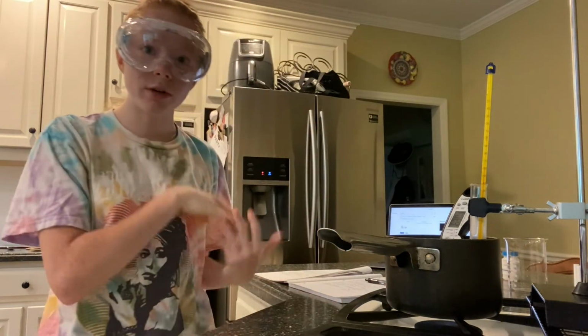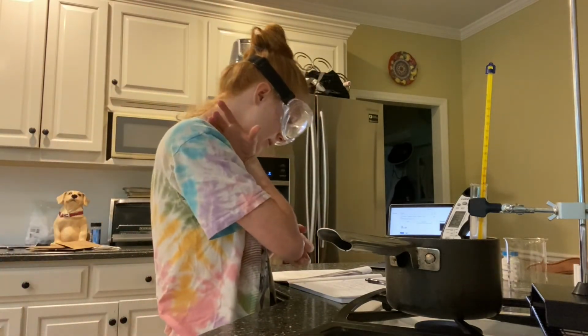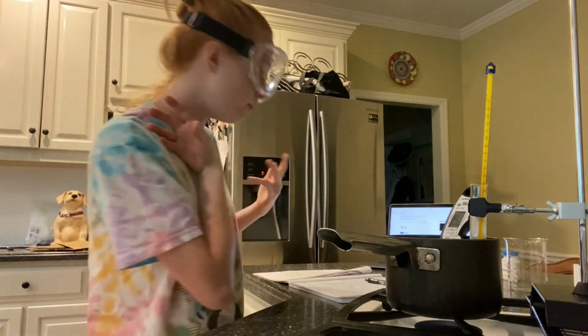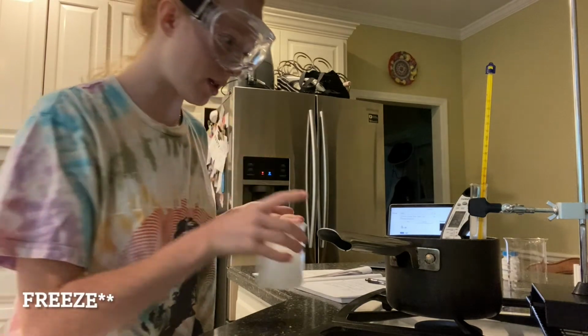And now I will move on to part D, in which I repeat steps 1 through 6 from part B, which is to freeze.